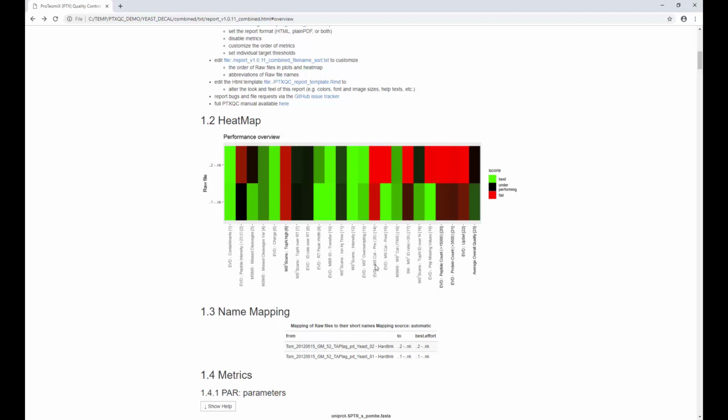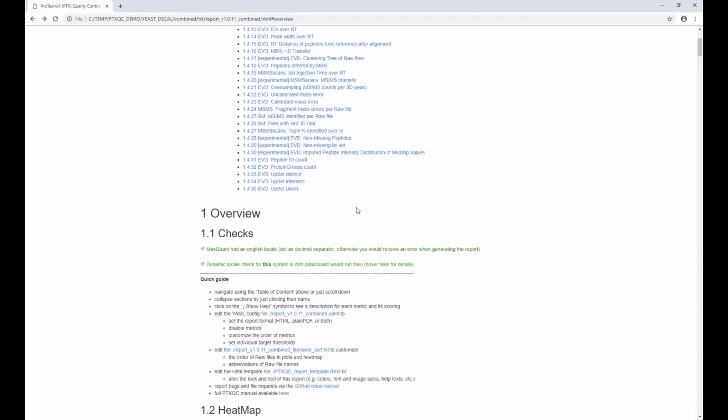What we can see here is the mass calibration before MaxQuant corrected it. And this is the corrected calibration values after MaxQuant did an in silico correction, basically. So this seemed to work very nicely for one file, but it didn't work for the other. And this might actually be the reason why we see bad peptide intensities, because if the calibration failed, all the peptides that we identified are probably wrong anyways. You can also see that in the identification rate for all the MS2 spectra, it's, well, okay-ish for this sample here, and it's really bad for the other. So all of this might have to do with our mass recalibration not working properly. So let's quickly jump to that section and we can use the index here above.